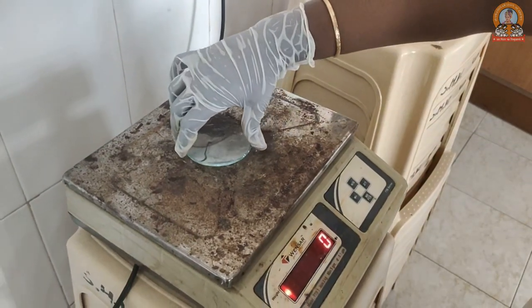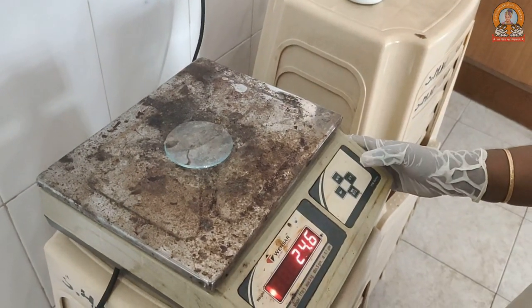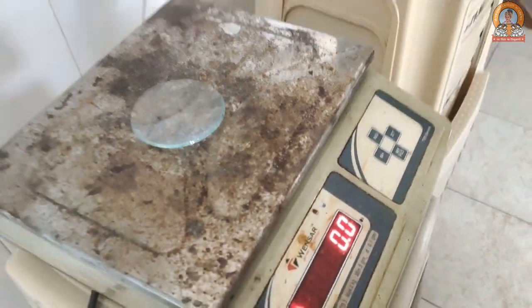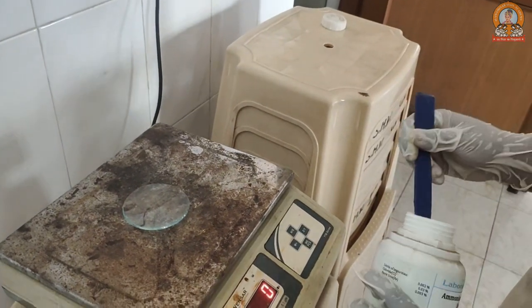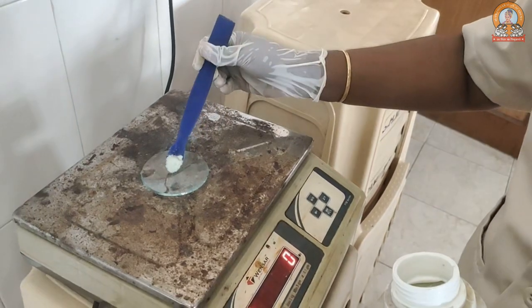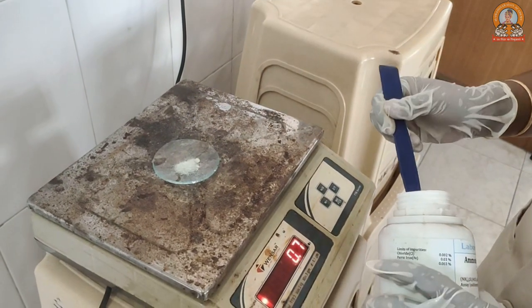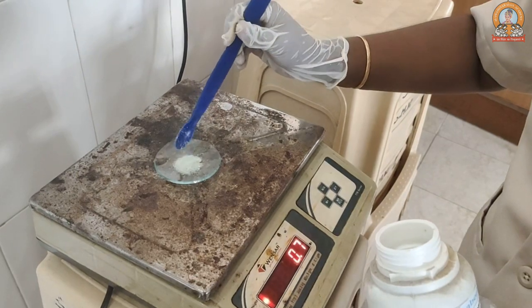We keep a watch glass over the balance to weigh our salt. We bring it up to zero and then weigh 4.9 grams of Mohr's salt.